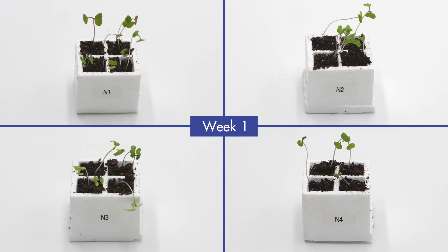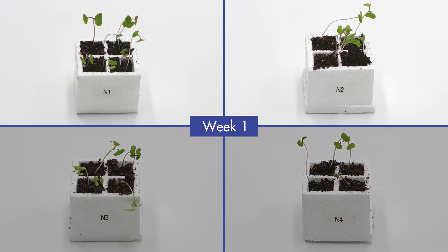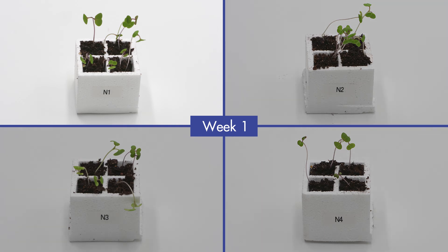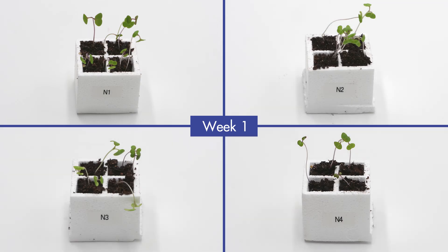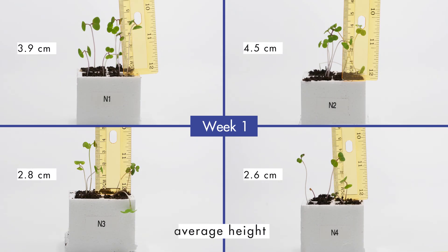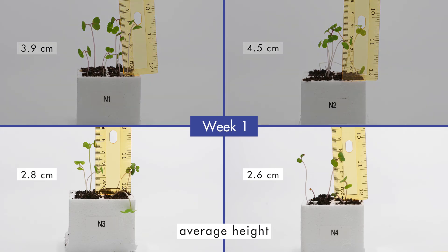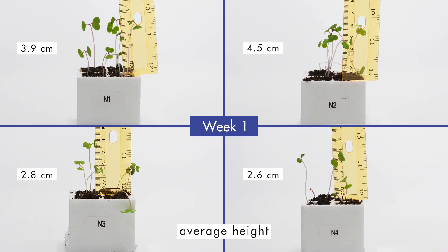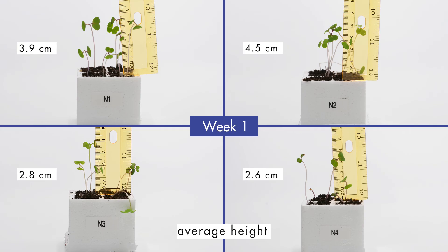Observe the four groups of plants at the end of week one. Notice that the plants in groups N1 and N2 appear to be the healthiest. Although the plants in group N1 did not receive as much fertilizer, there were nutrients already present in the soil. Record your observations for all four groups. The plants in groups N3 and N4 are not as tall as the other plants, so our hypothesis does not seem to be valid. Record the average height of the plants in each group in your journal.